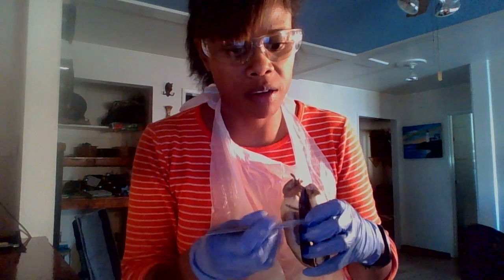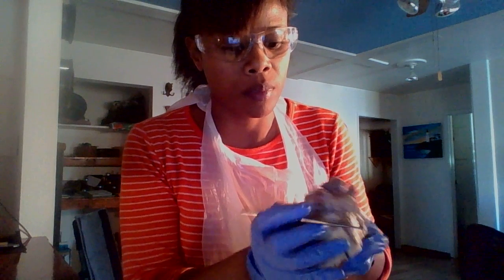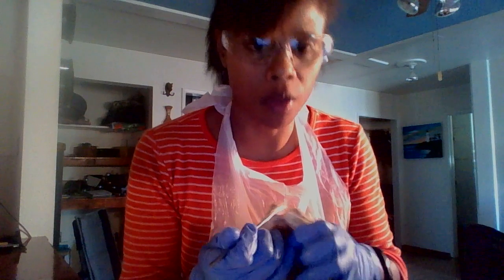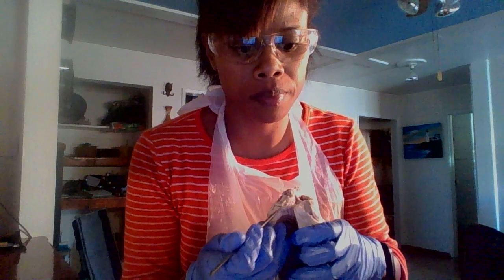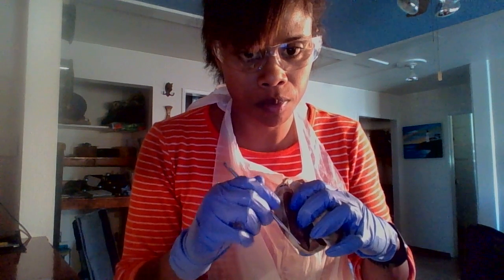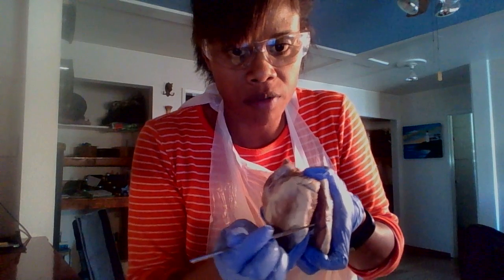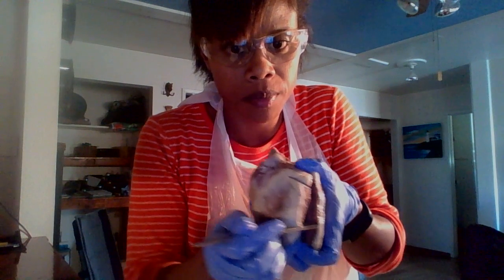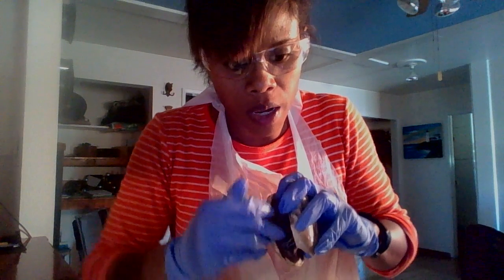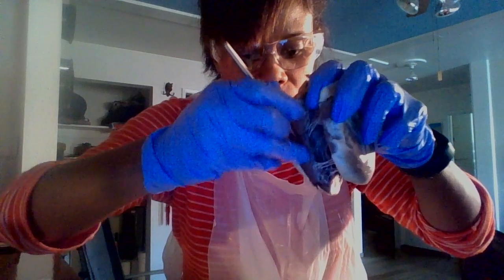So we have the pectinate muscles, which are here on the inner wall of the right atrium. The myocardium is on the right and the left ventricle. The trabeculae carneae is on the inner surface of the ventricles.